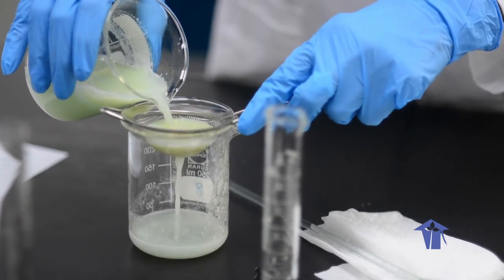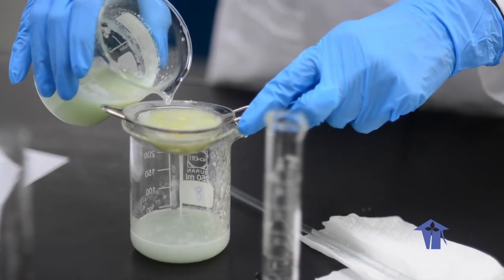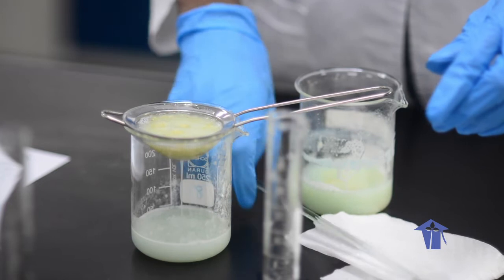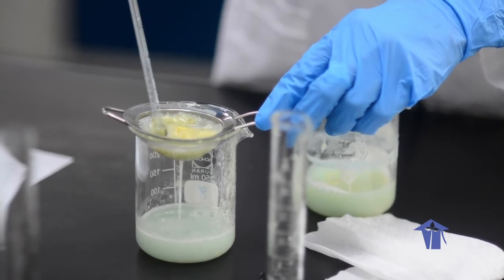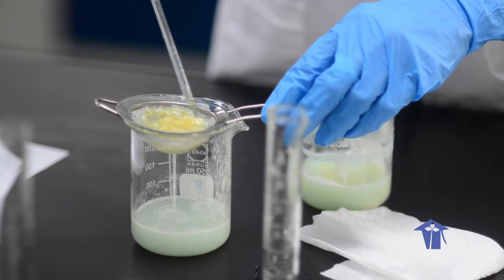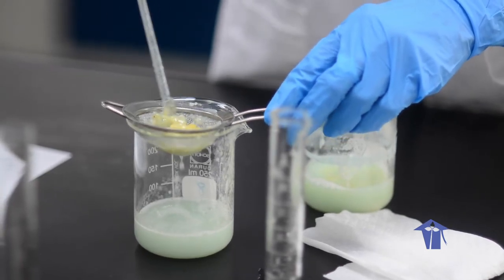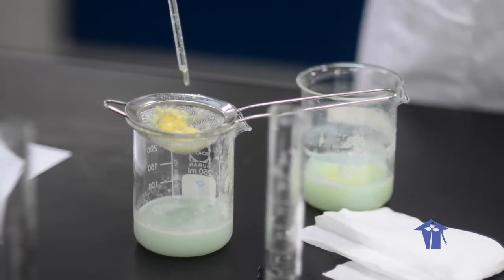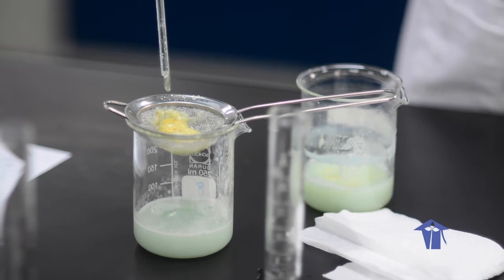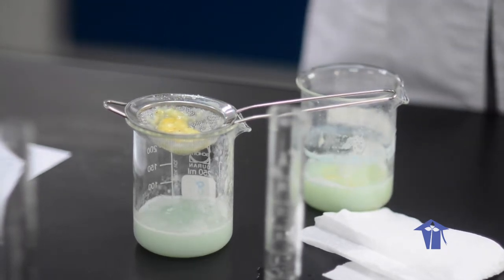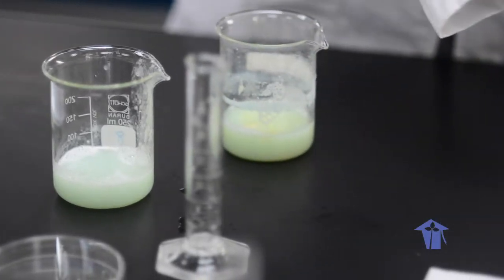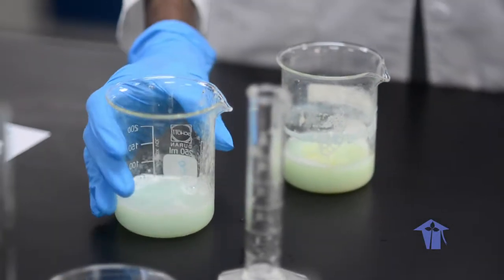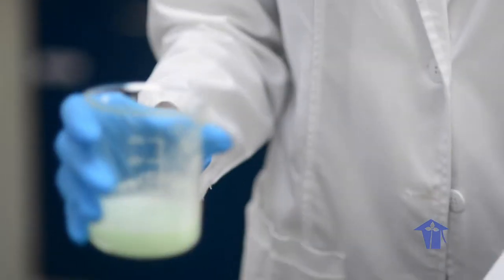So, I am pouring this into here. Just to make sure that it does not overflow. You may not need all of the solution that you have created. I am going to set aside the strained banana. So, in this container, I should now hopefully have some banana DNA.